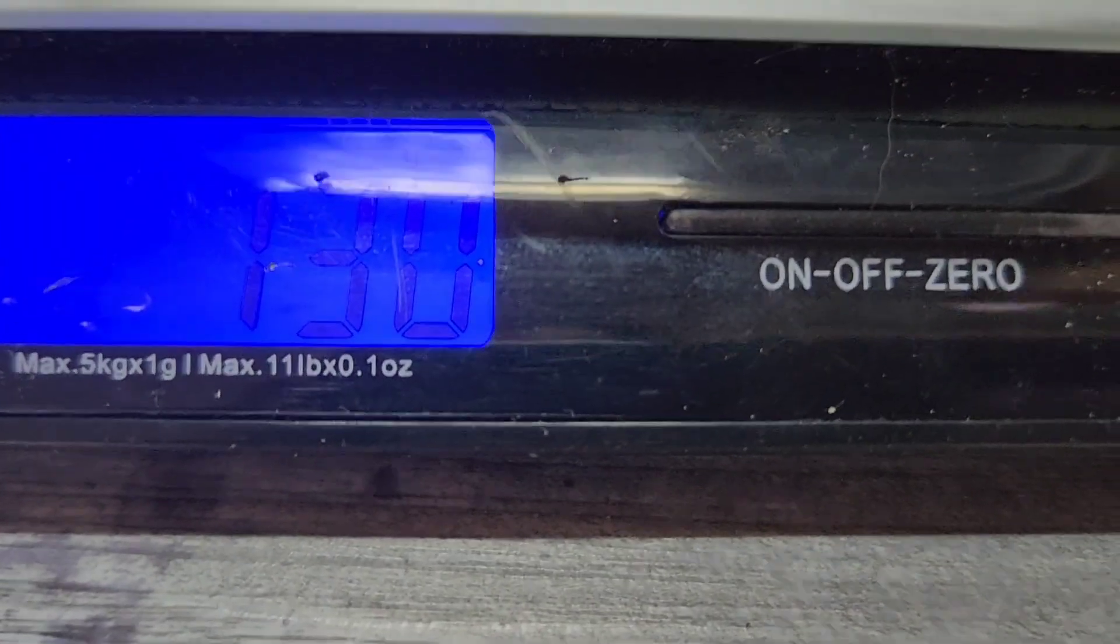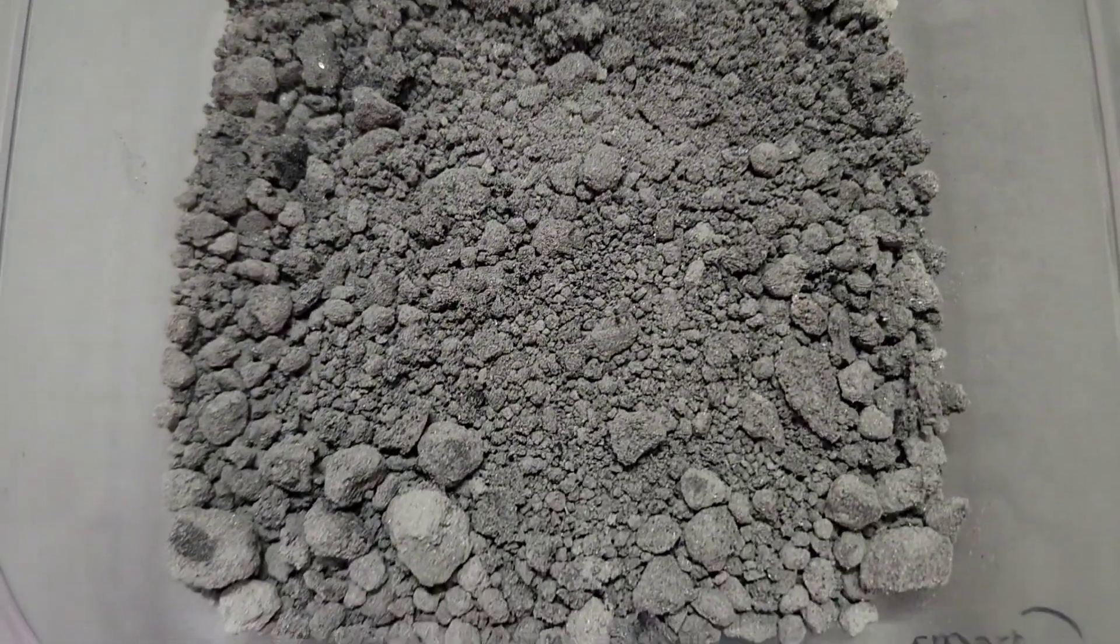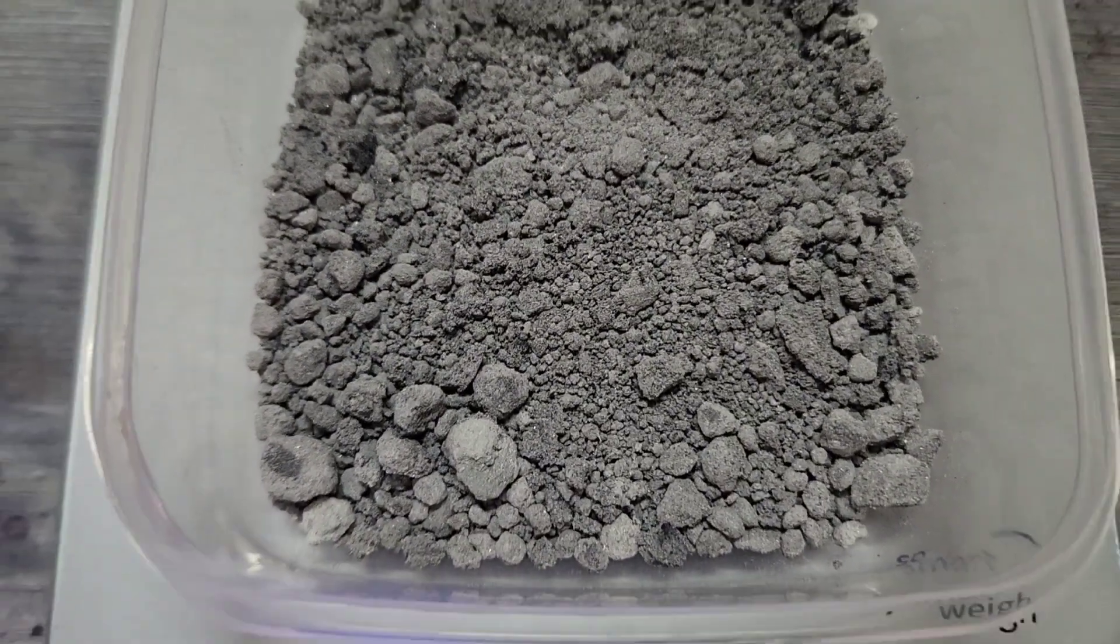All right, well we've got 130 grams of cement silver. Not too shabby.